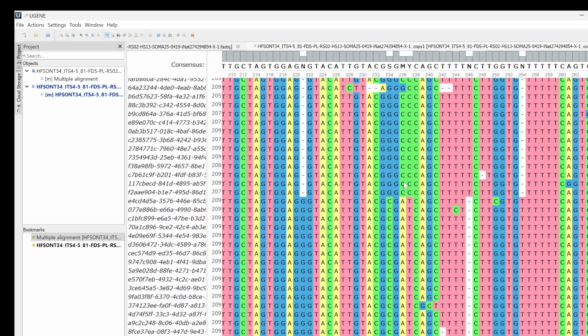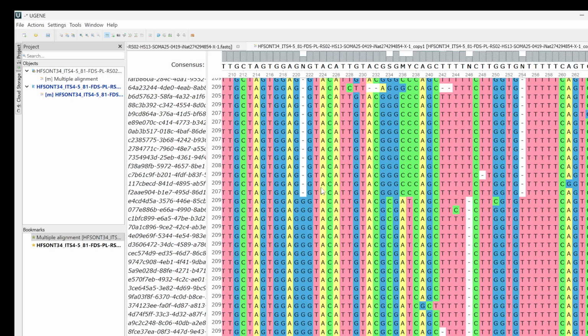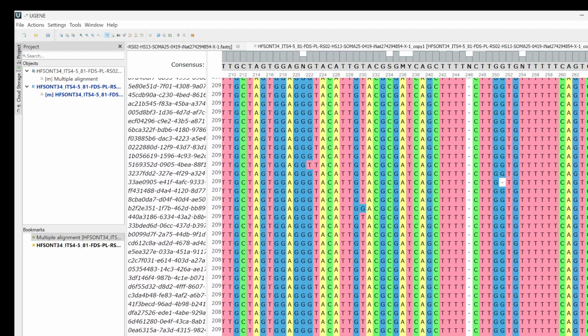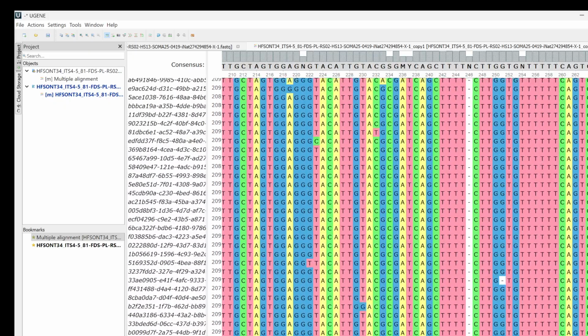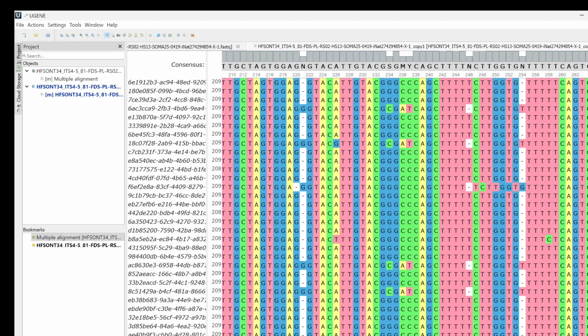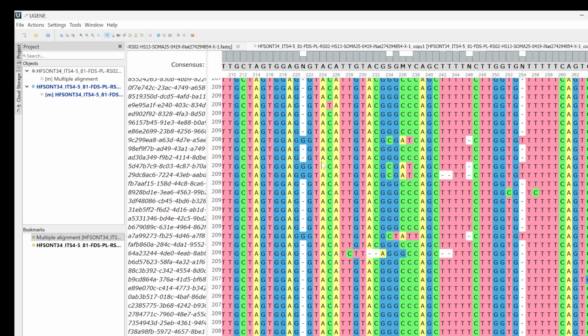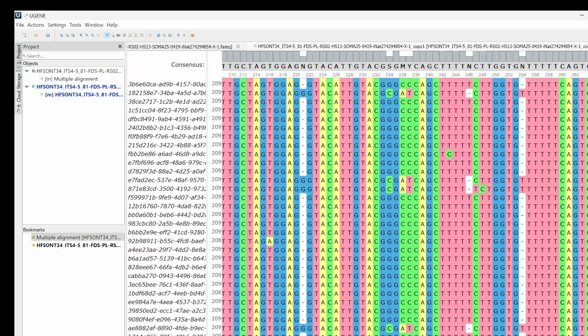And with older sequences, you might see something like this when there's a mix of forward and reverse reads. But in this case, we know that reads are all in the same direction. And if it was a mix of forward and reverse reads, it would be totally messy here. So it looks like MAFFT did a pretty good job of phasing these out into two chunks. Normally that's not the case, so I'm pretty impressed there. I think there might be a few here where it's not looking very good. So let's see if we can do it a different way.